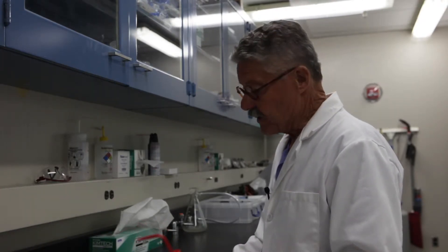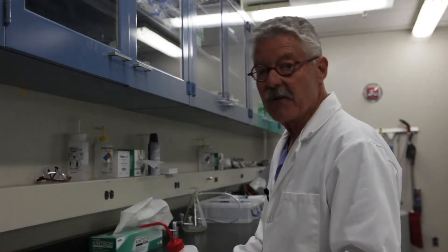Now for filming purposes, we're using acetone outside of the fume hood, but when you're doing this procedure using acetone, you must always be under the fume hood.